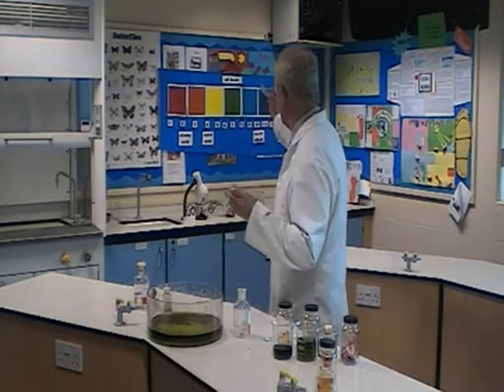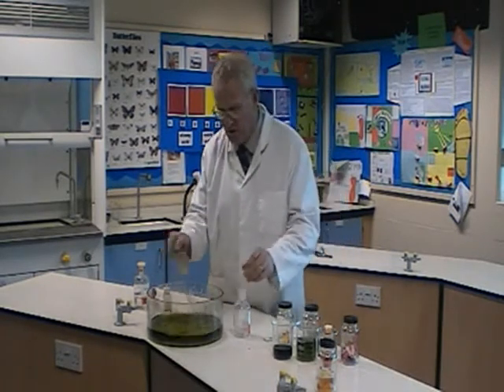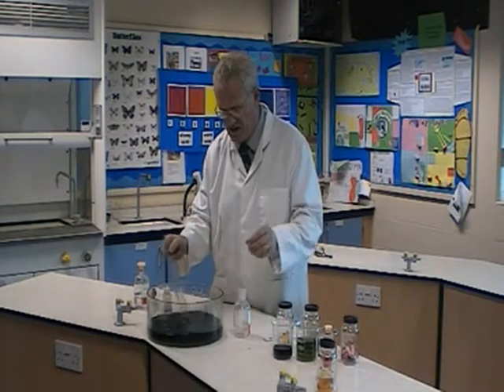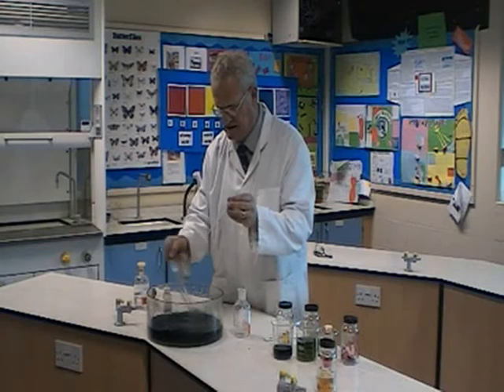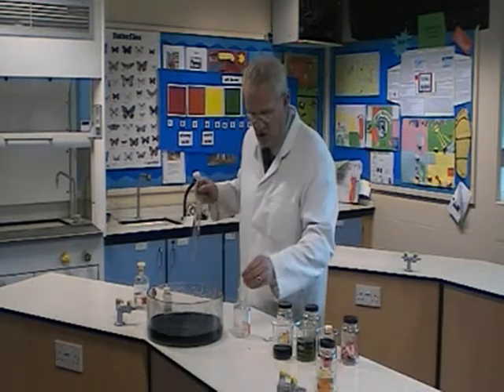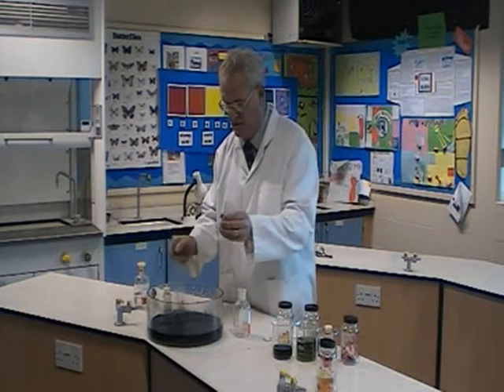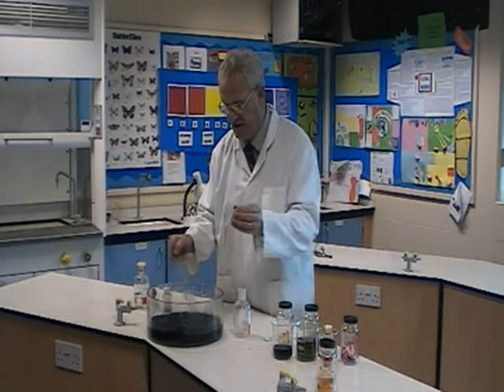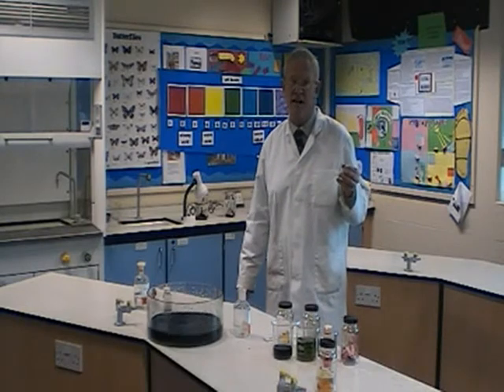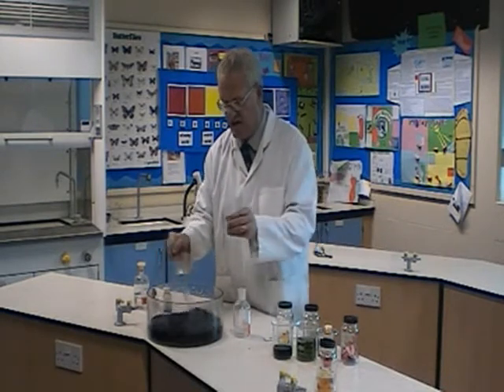To show you the rest of the pH scale — that is pH number 7. I'm going to keep adding the alkali to go through the final three colors. I want a lovely blue color — there is my blue. If I add a couple more drops I will go to indigo, which is halfway between a blue and a purple, like a dark blue. There's my indigo — basically like a dirty blue. And finally, when I've gone fully to alkaline, I should have a lovely purple — and there it is, the lovely purple.